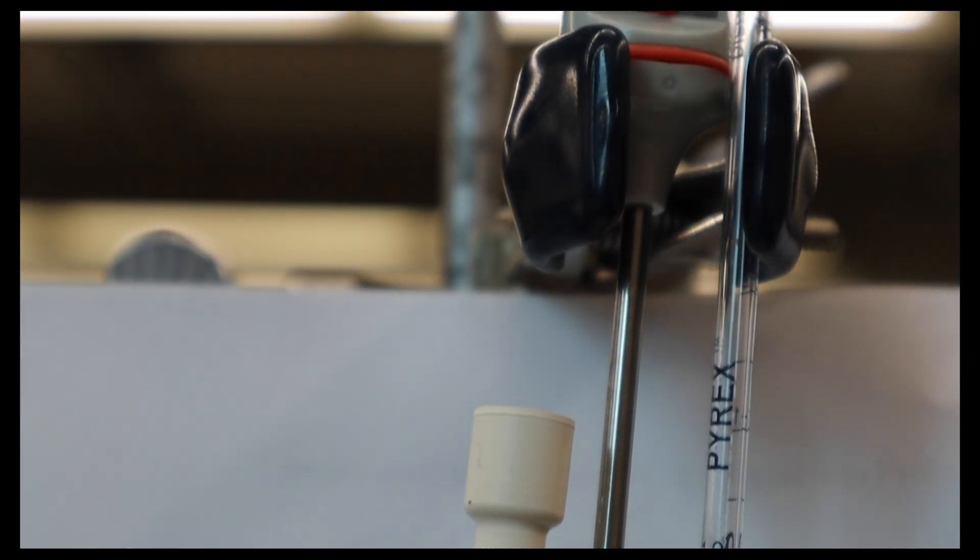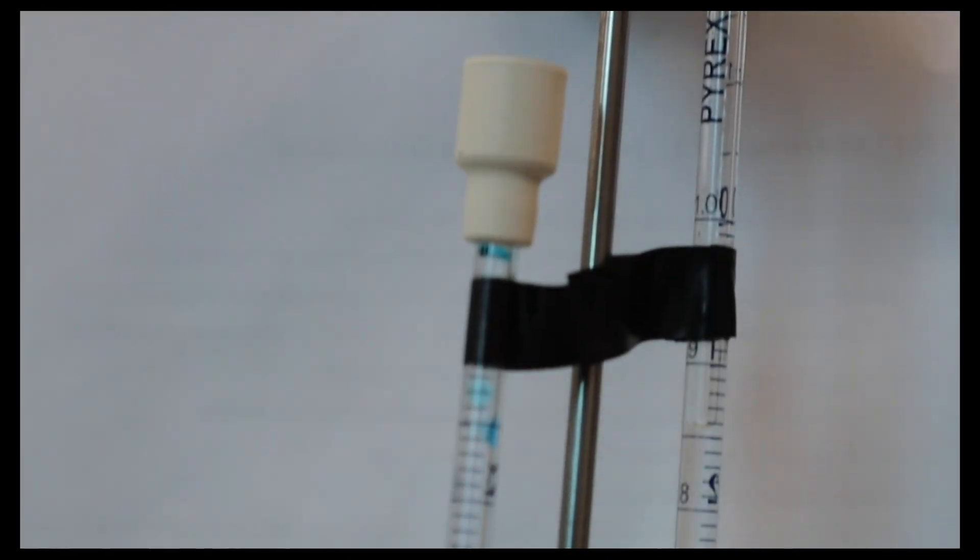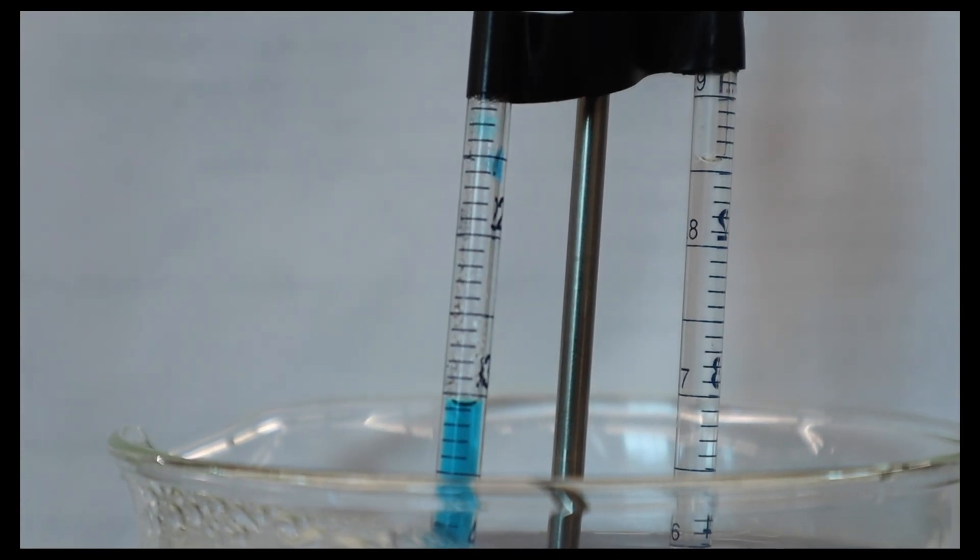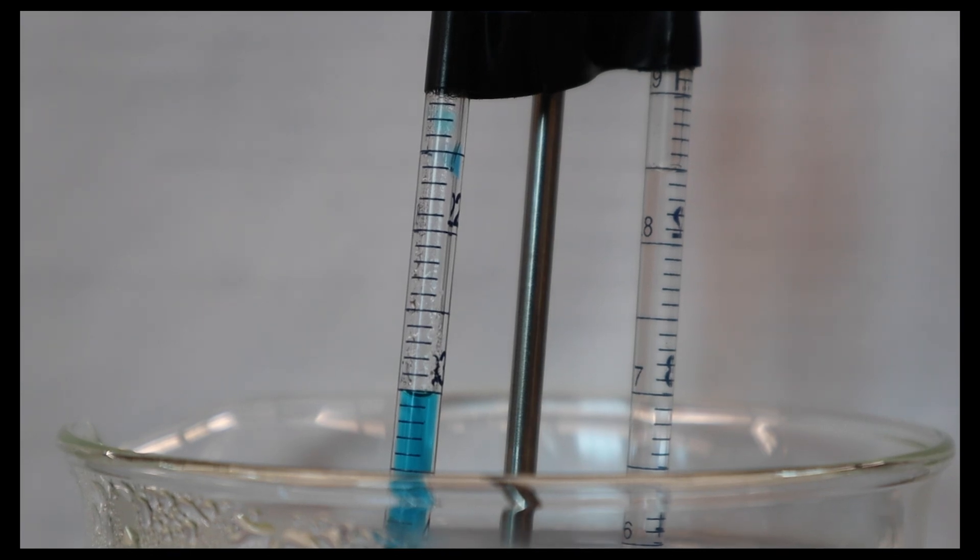This is all we're basically doing is we're taking the size of this bubble by measuring the little marks on the side of the pipette marks and checking the temperature. We do this over and over again.